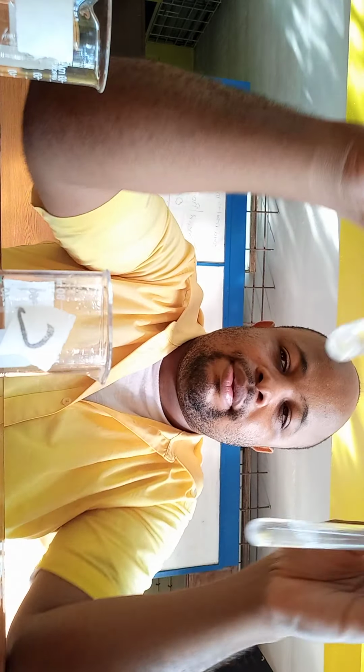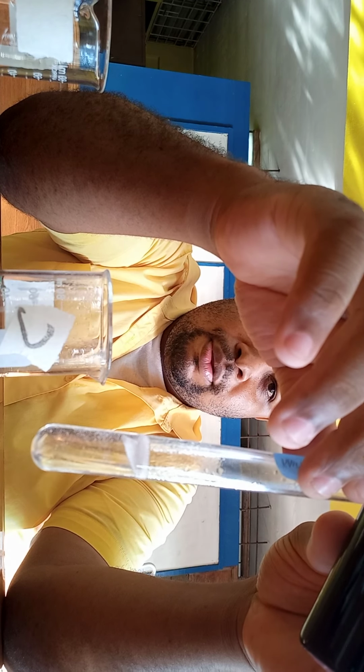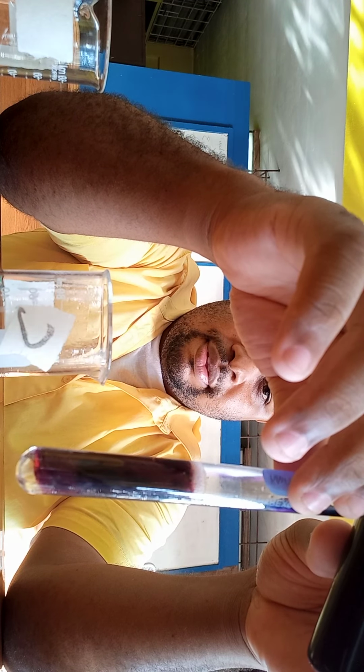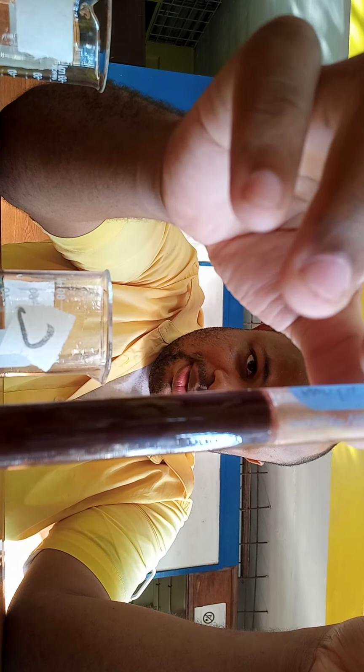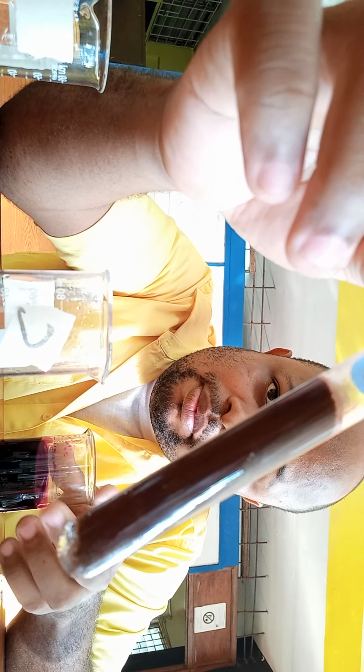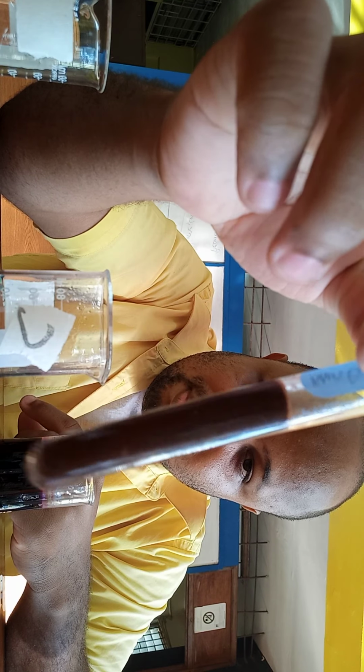Hope you're seeing that. So I'm going to try, let's add potassium permanganate, a lot of it, and see what happens. And see if it slows down the reaction. I'm going to add a lot of it. This is us trying to differentiate, just following up with the primary. We already oxidized it, right? So we know it should be a ketone and the other one should be a carboxylic acid.